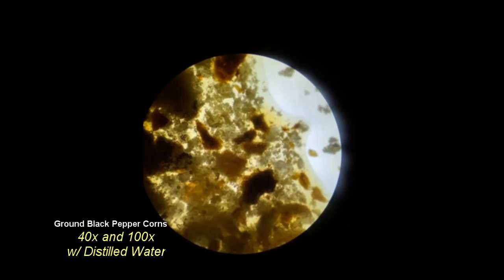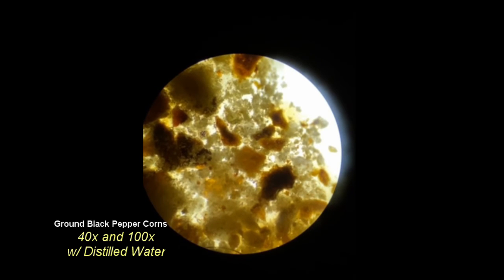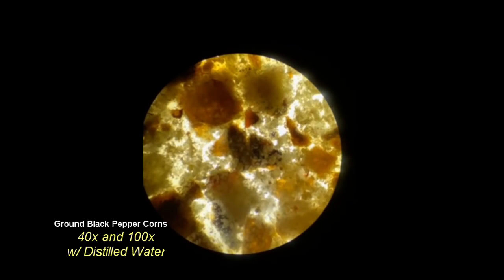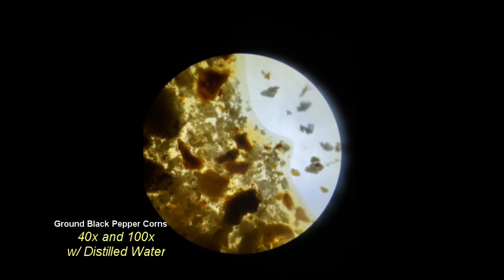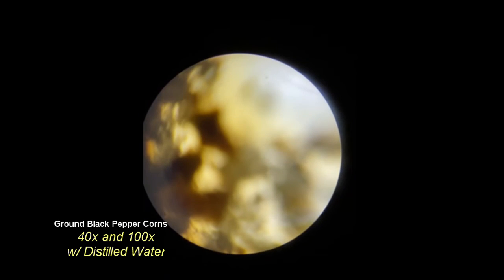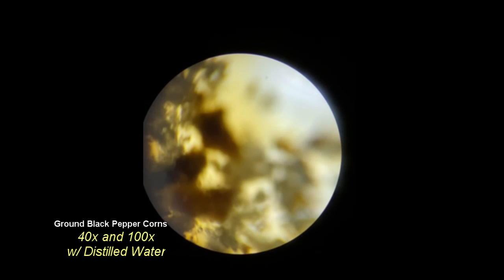Originally in the experiment, I had only planned on one filtration using the steel mesh, but after seeing the results of the black pepper, I decided to do additional filtrations to clear the water as best I could. After 3 filtrations, the water cleared some, but remained very brown.